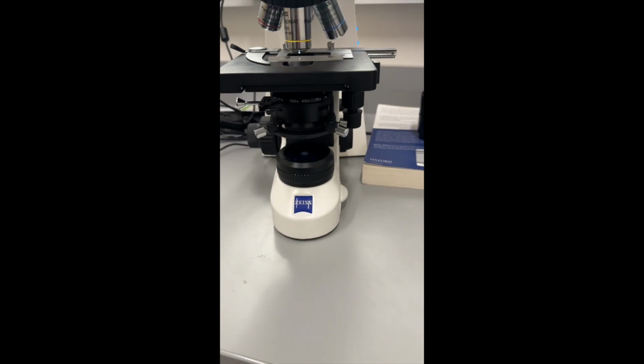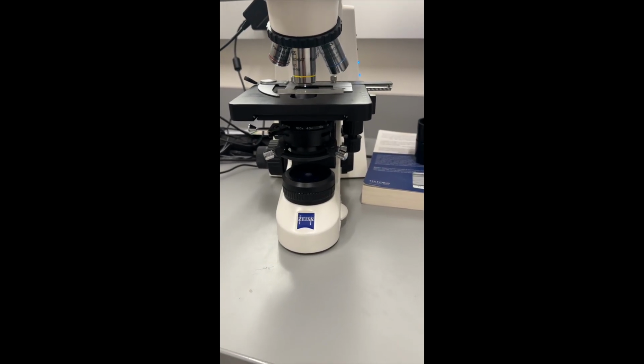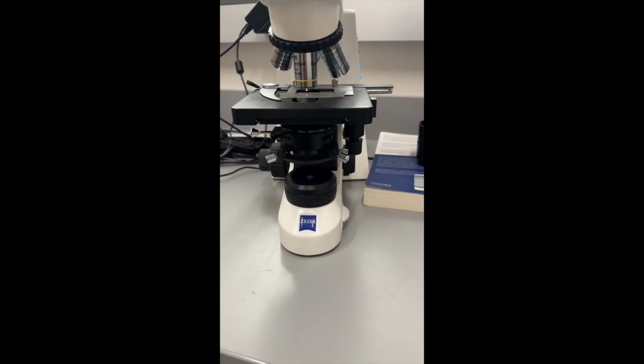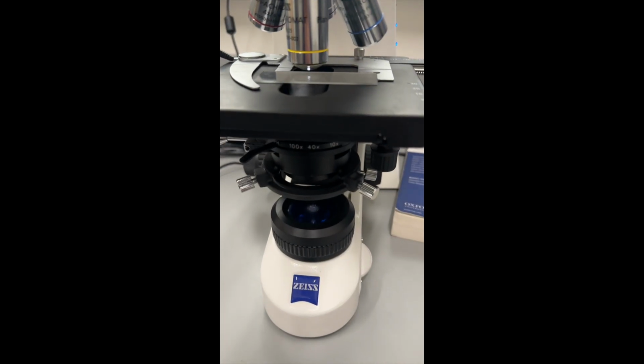I think first we're going to start off, I'm just going to show you guys the individual pieces of the functions and different things on the microscope. Okay, so we're going to be going over the main components of the microscope that we utilize when setting up Kohler calibration. For our microscopes, Kohler illumination, calibrating the Kohler illumination, it's all the same stuff.